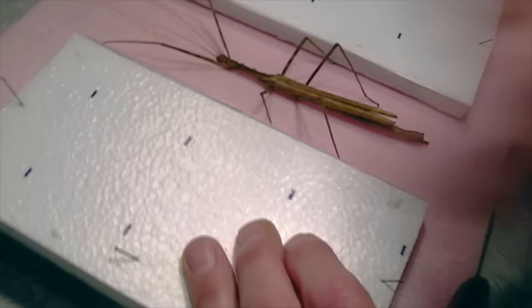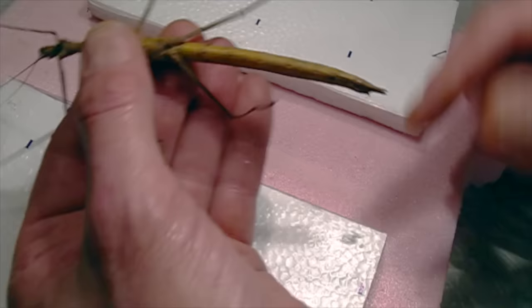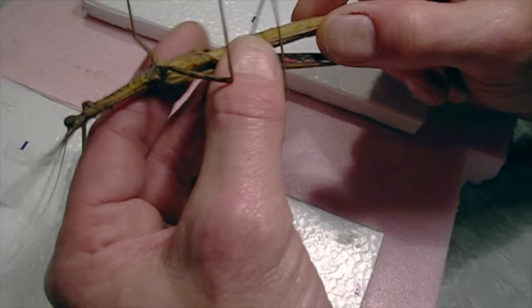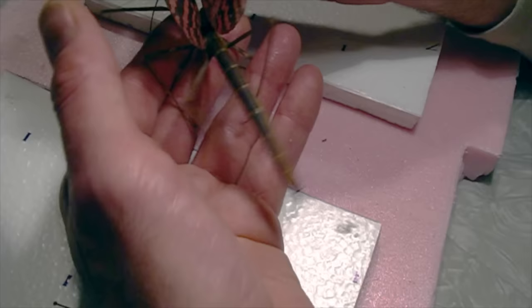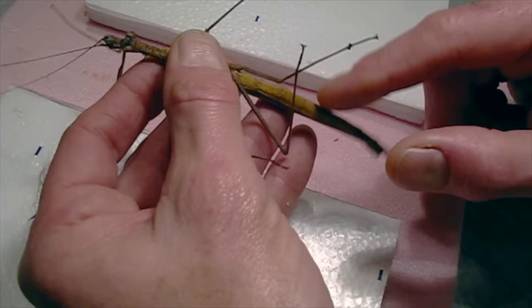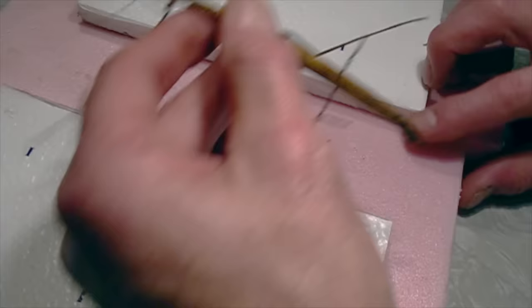Before we're ready to do this, we have to deal with the gut contents. These stick bugs have a fairly thin and soft exoskeleton, so if we just pin them they tend to rot and shrivel up. I don't really want that — I want it to look fairly natural when we're done, so you get the abdomen looking like it's supposed to. I'm going to open it up along the bottom and pull the gut out. There are bound to be some eggs in there too.